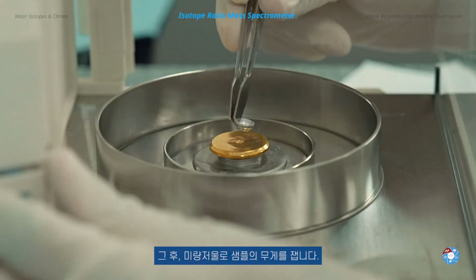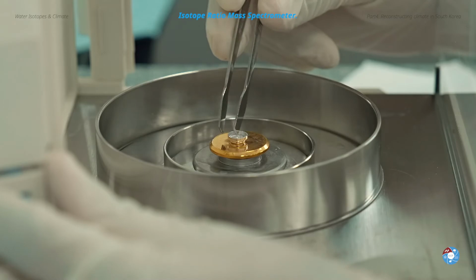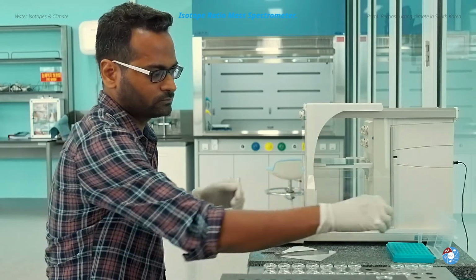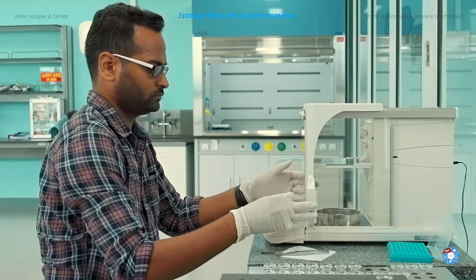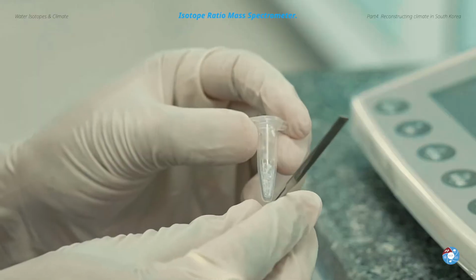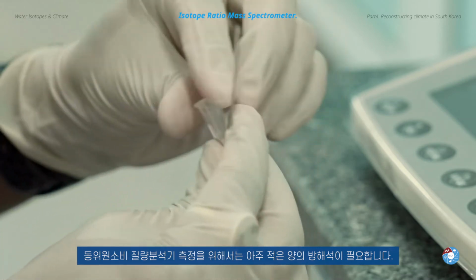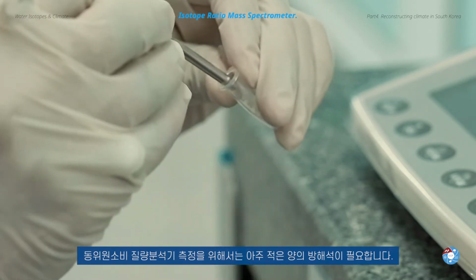Afterwards, the sample is weighed on a microbalance. For our isotope ratio mass spectrometer, we only need a tiny amount of calcite.